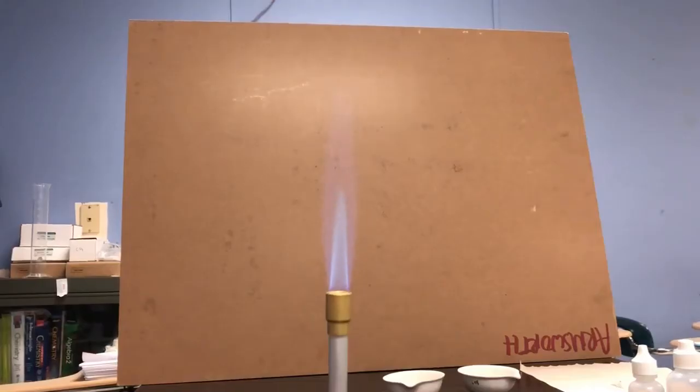I'm going to set this one down for now, and we'll come back and revisit it later. Next, we're going to look at experiment 1. Experiment 1, the reaction is actually already going on here. I have lit the Bunsen burner. The Bunsen burner is fueled by carbon tetrahydride, CH4. It's the flammable gas that's being burned right now. So it's colorless.